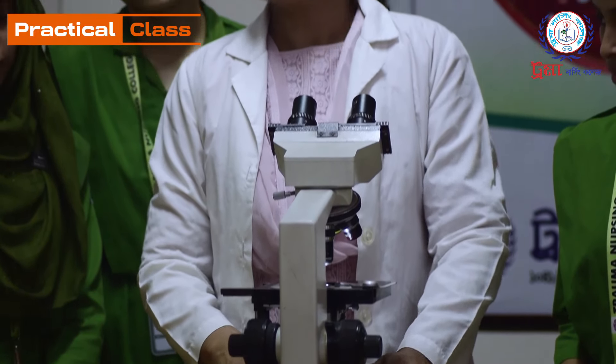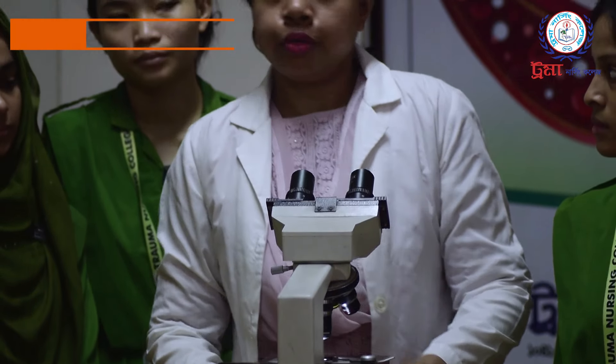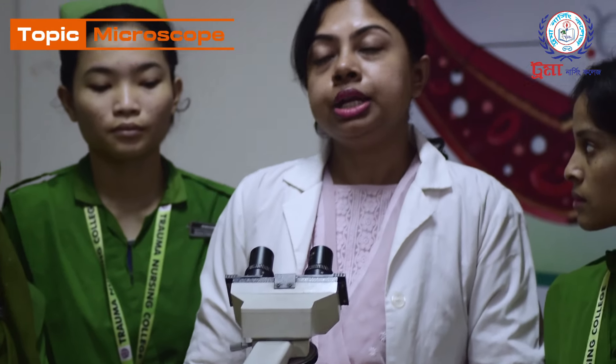So these are the parts of a light microscope. Thank you so much for watching this video.